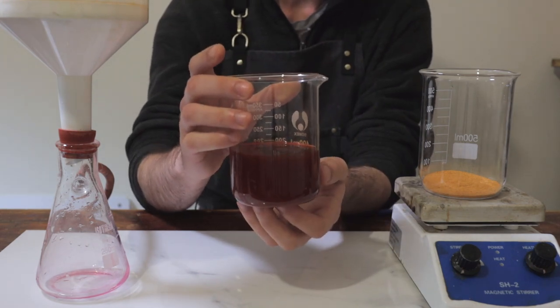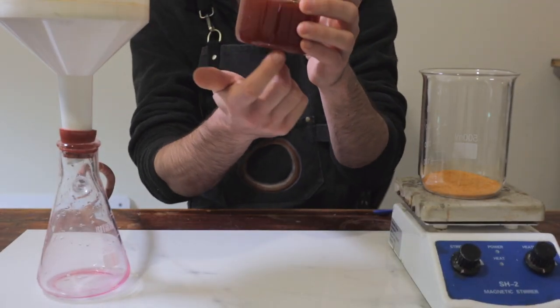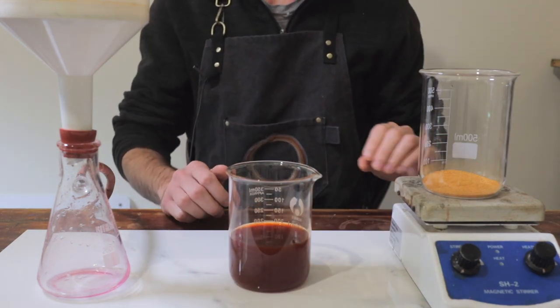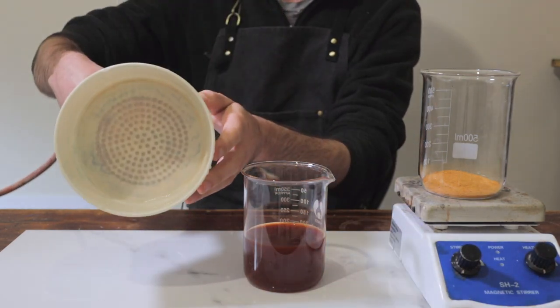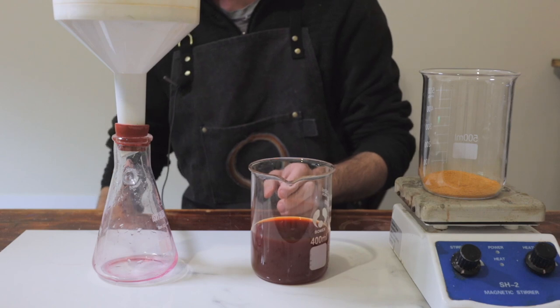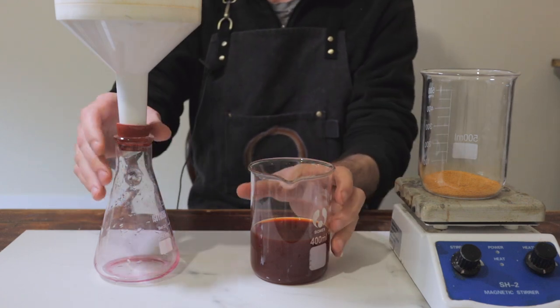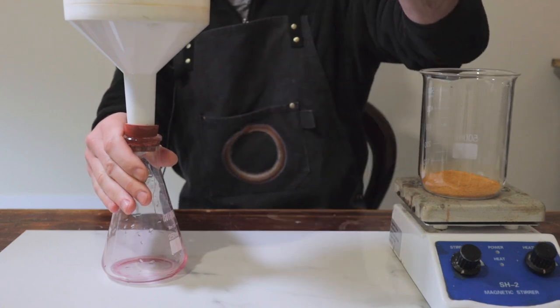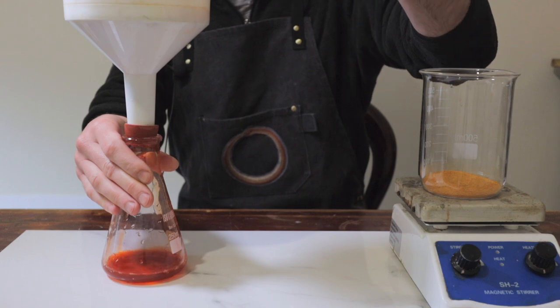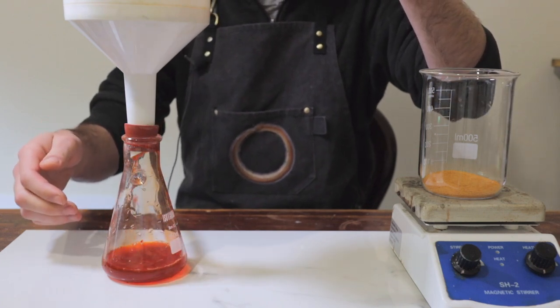We're back after a couple of days. This is our liquid here that we've been collecting, and I think there is a little bit of sediment that has formed at the bottom and a little bit of scum forming on the top. Basically what I'm going to do now is take it through filter paper in a large funnel hooked up to the vacuum pump, and run this through to see if we did collect any sediment impurities, as was said in the book. Everything seems to be coming through nicely and quickly.